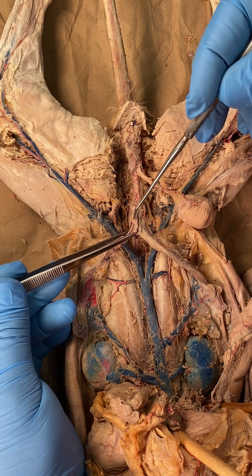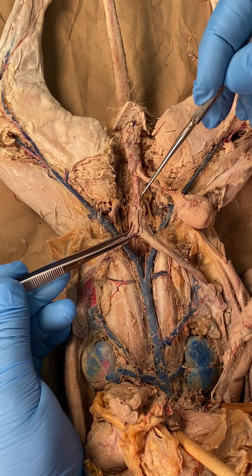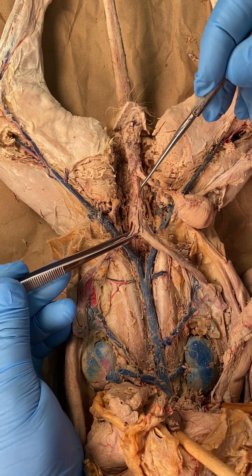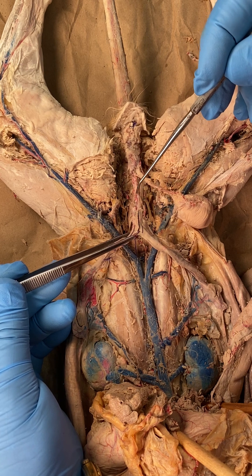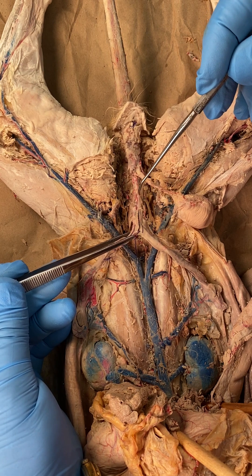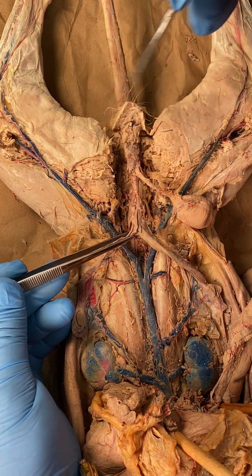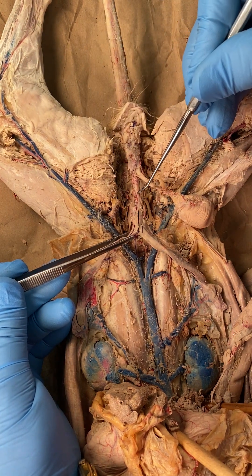Uterine body leads to the vagina. There's the vagina. There's a little swelling right there — it's hard to see, but you can actually feel it more than you can see it. And that's the cervix in the cat.